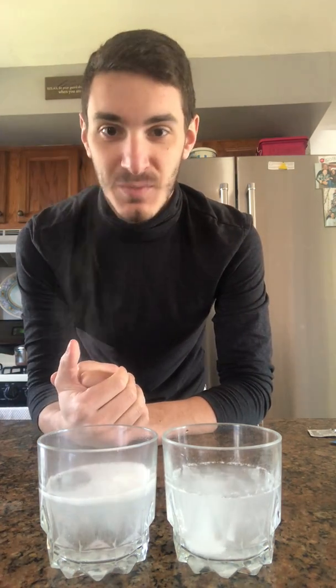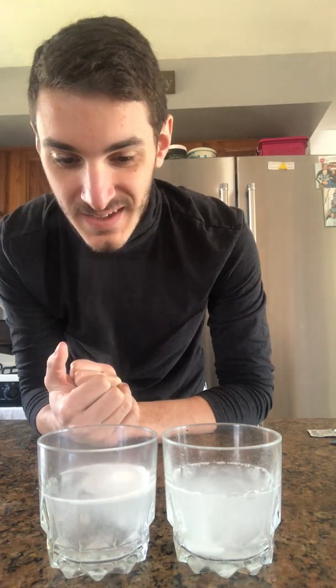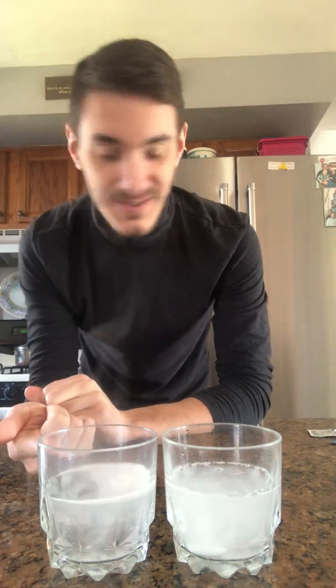As you guys can see, the one in the hot water just immediately started reacting super super fast. The one in the cold water is doing exactly what the other ones have been doing. The one in the hot water is done reacting at 18 seconds.